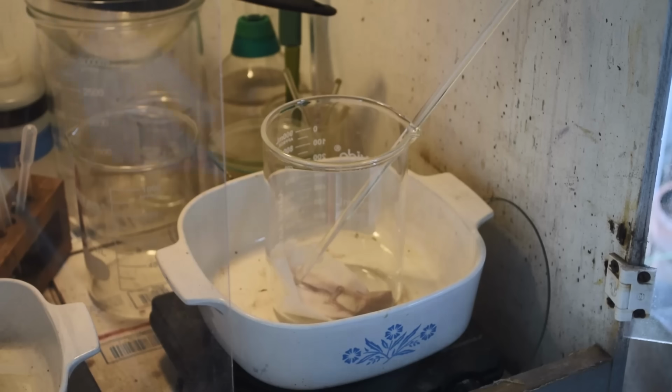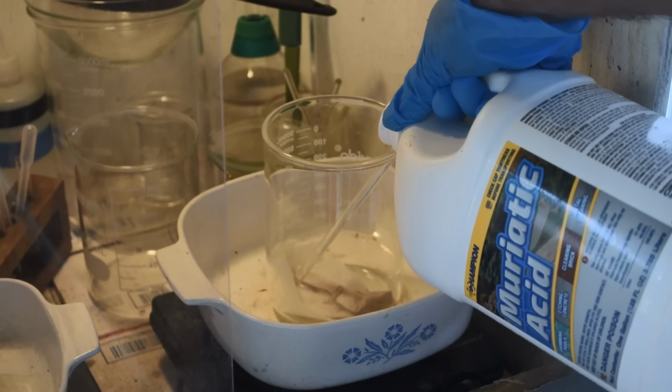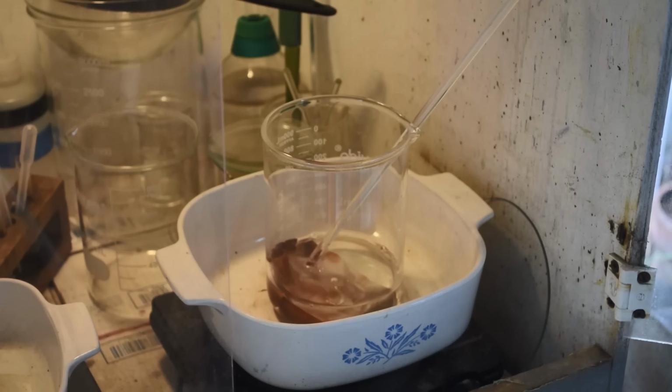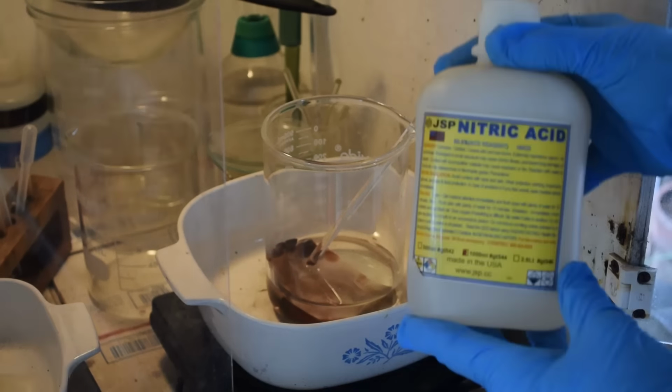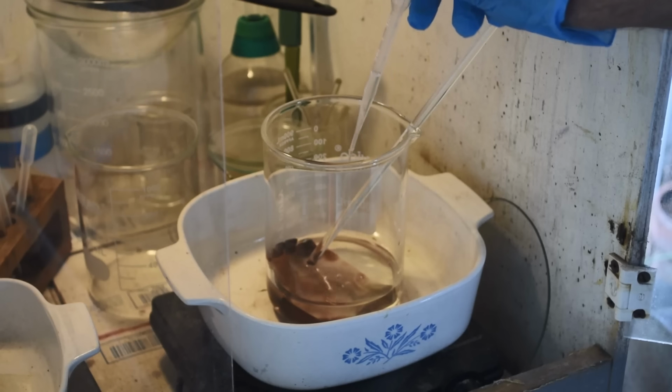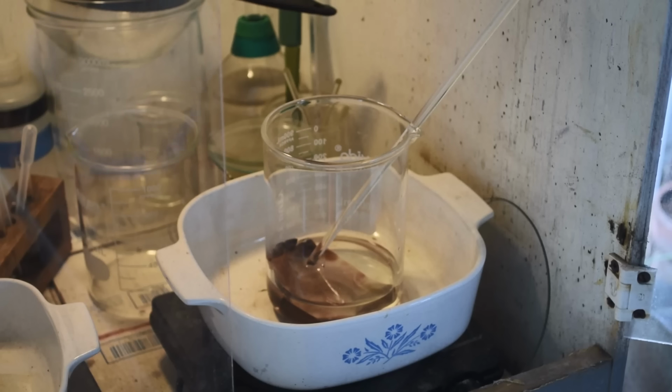All right, let's make some aqua regia. Oh, that's interesting. Immediate big color change in the filter. I don't know what that means, but it's interesting. All right, so that was muriatic acid, some nitric acid in there. Not too much. Not a lot of material there. That's probably more than enough. And we shall see what happens.